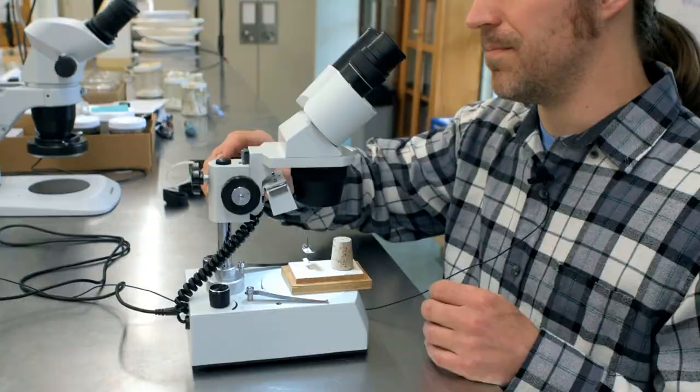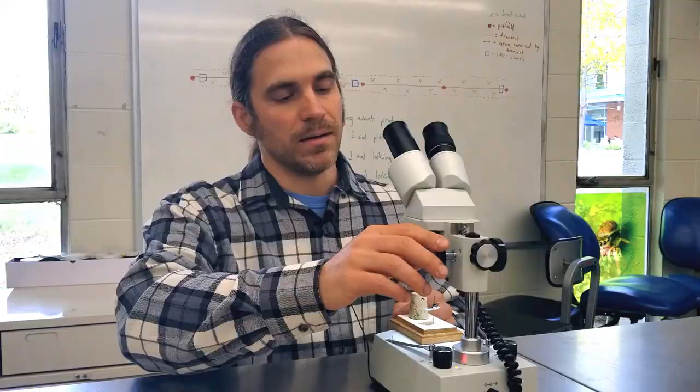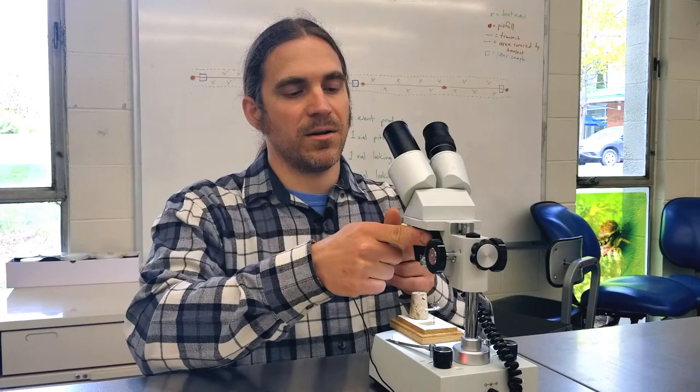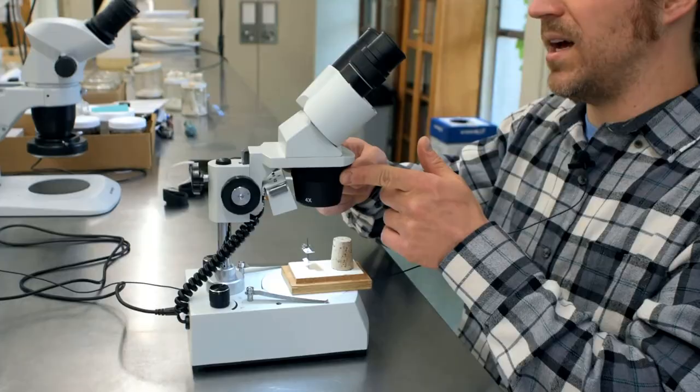Most microscopes will have some kind of zoom. Depending on the quality of the microscope, the zoom may vary. This model in particular has a 2x and a 4x zoom, and those can be chosen by rotating this knob right here under the head of the microscope. So I'm on 4x now — if I turn it clockwise halfway around, it goes to 2x.